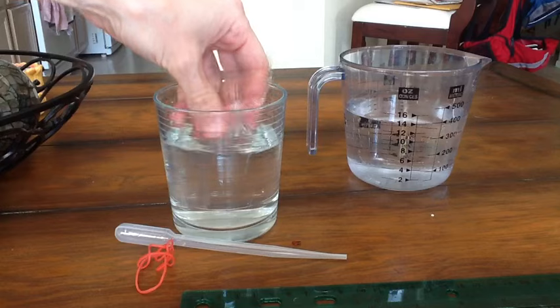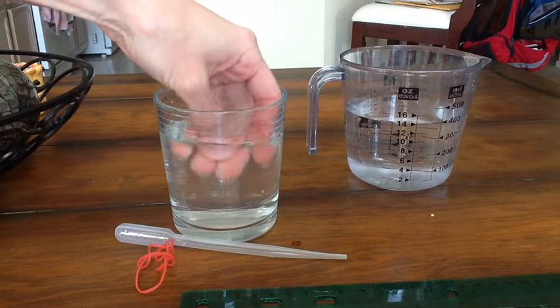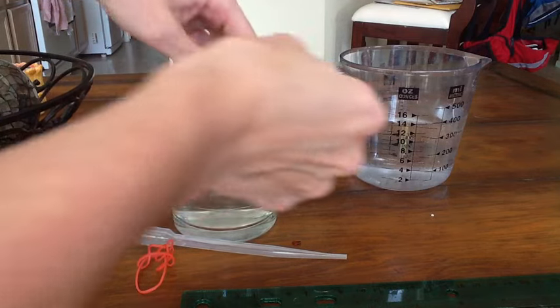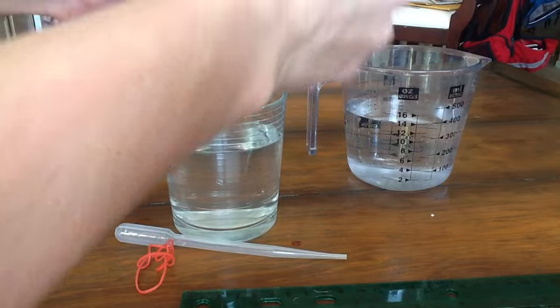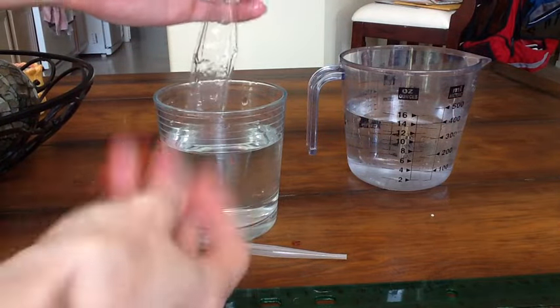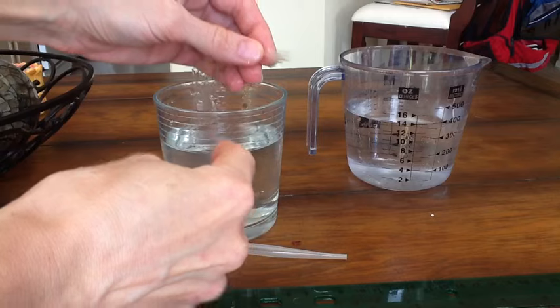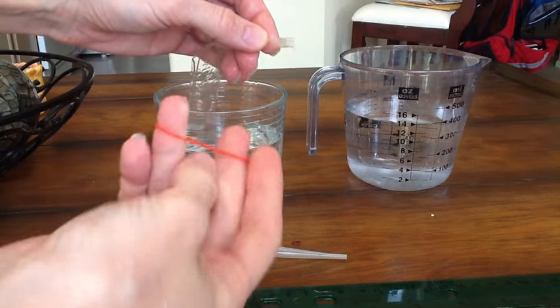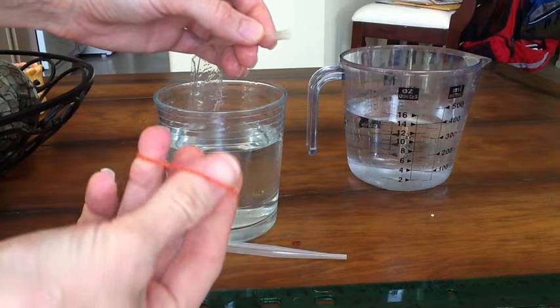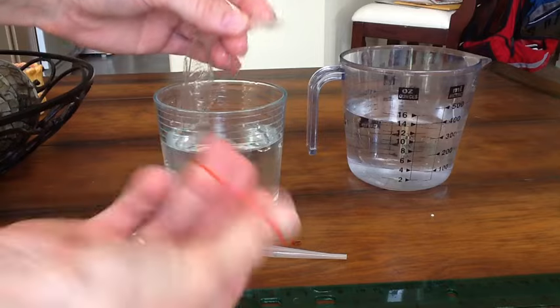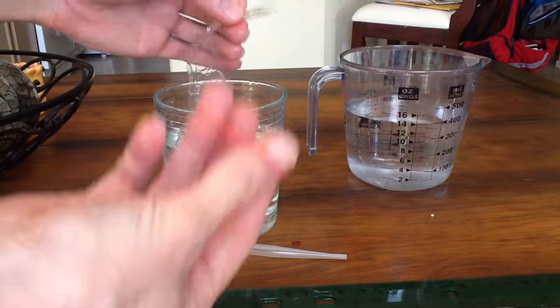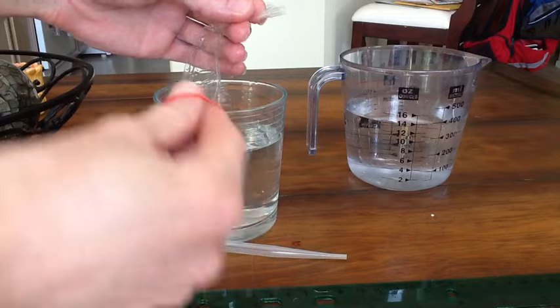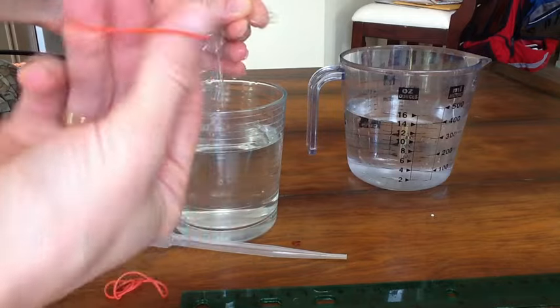So you can keep doing that until the entire tube is open and now it's all open so that now I actually have a tube. For our experiment that we're going to be doing we need to turn this into a model cell that contains a solution inside. So in order to do this I need to tie off both ends of the bag and put solution in the middle of the bag so that it can be our model cell.